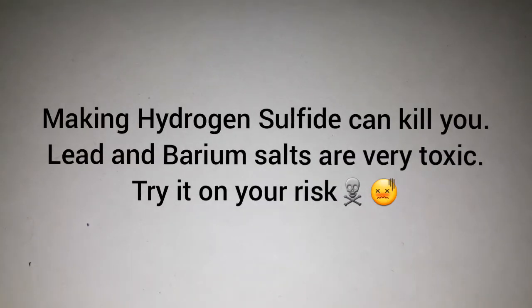Warning: This procedure involves toxic chemicals and gases. Making hydrogen sulfide can kill you. This is seriously harmful for your eyes, lungs, and health.